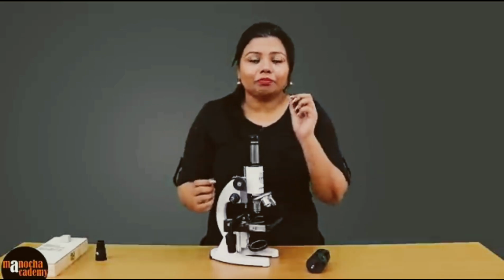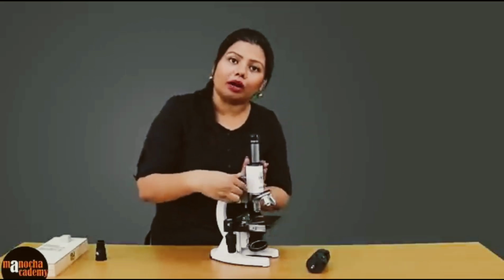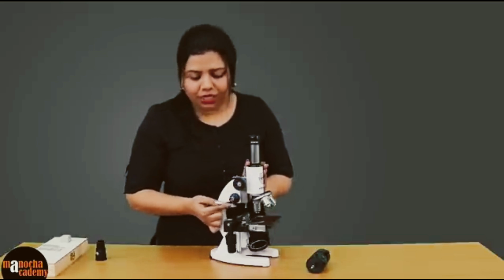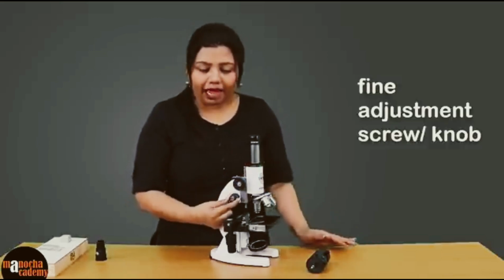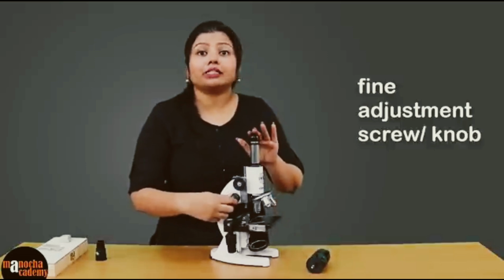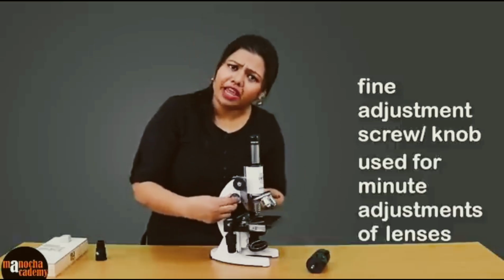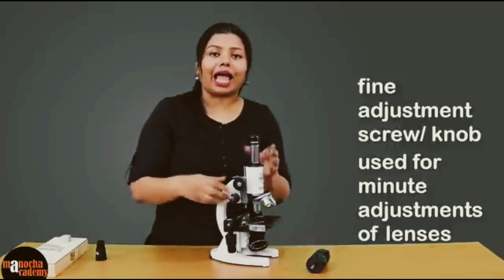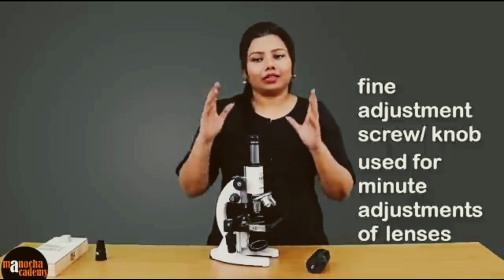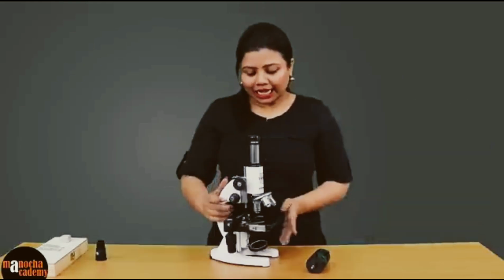So in that case, you might want to make fine adjustments, but you do not want to completely move the body up and down. In that case, we have this one, which is known as the fine adjustment screw. See, when I am rotating the fine adjustment screw, there is no movement of the body. So it is basically adjusting the lens very minutely without moving the entire body, and with this you can bring the specimen to your own focus, right?